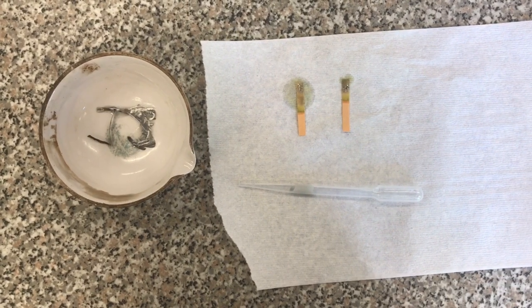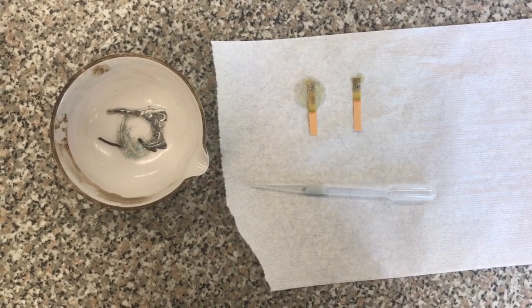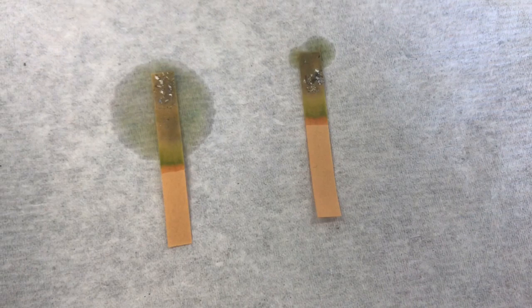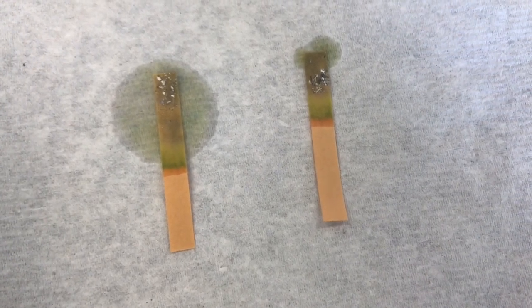As we can see here, the litmus paper indicates that the solution is basic, and therefore our predictions, as well as the theory behind these predictions, are correct.